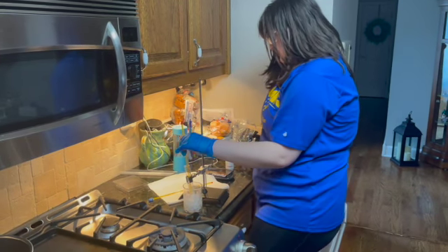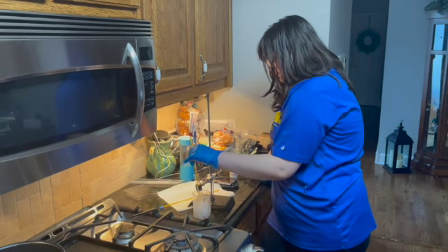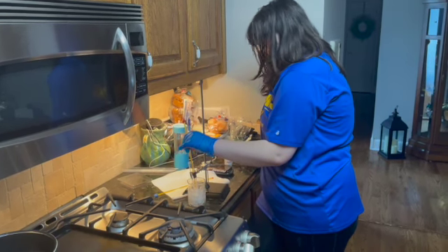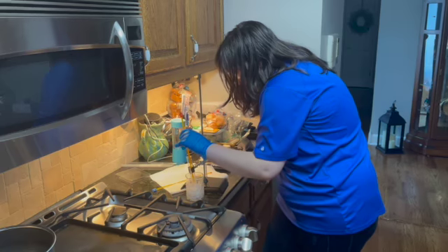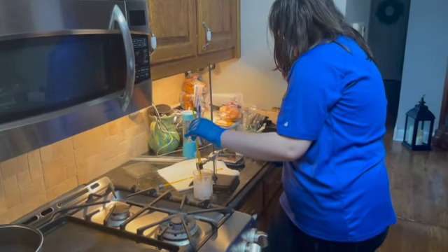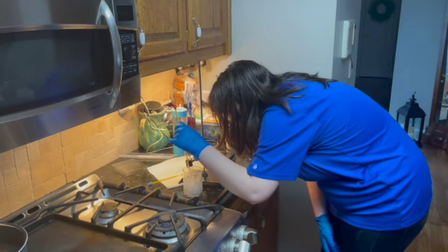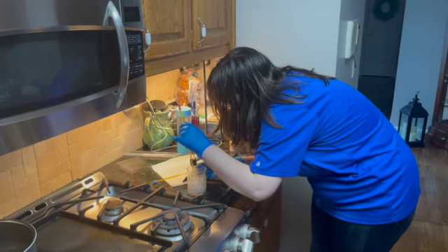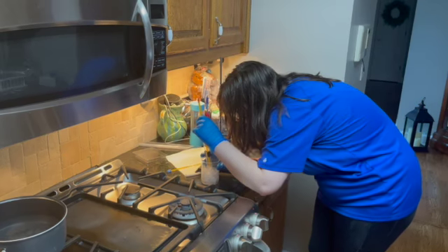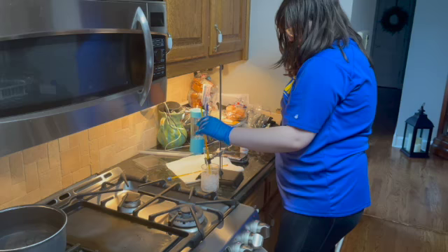Okay, so we're getting close to 5 minutes. Let's see, 10 more seconds. Okay, so we're at the 5-minute mark, and our temperature is at 30 degrees Celsius. And trying to take a look at it, there's still liquid left in the middle for it to freeze, so we've got to go just a little bit longer.